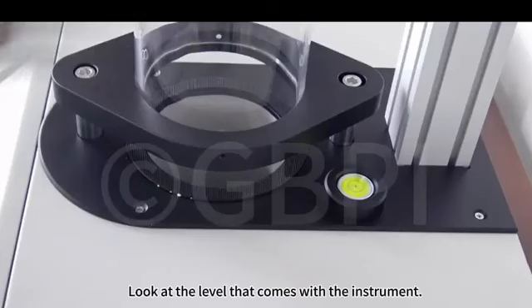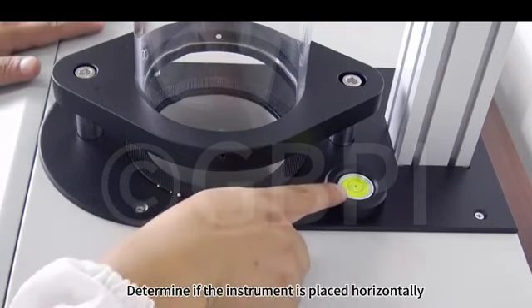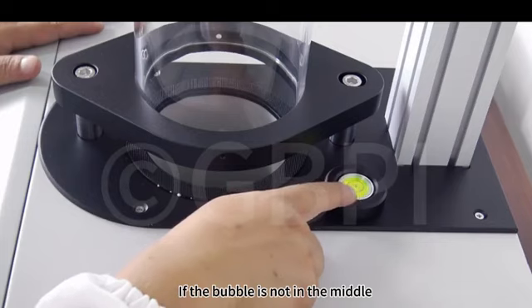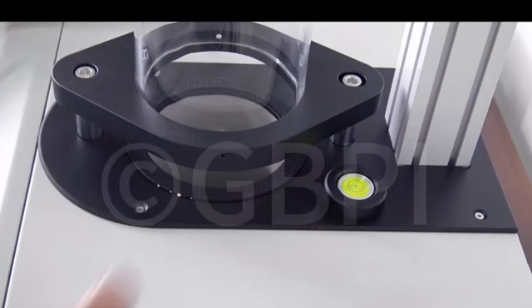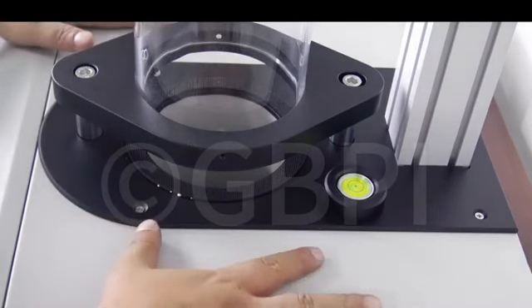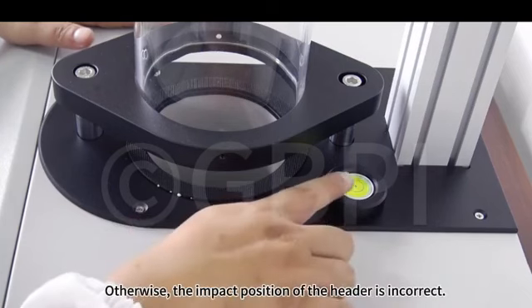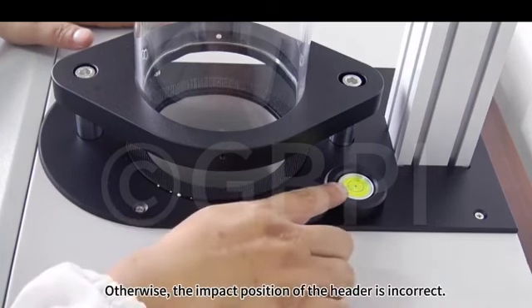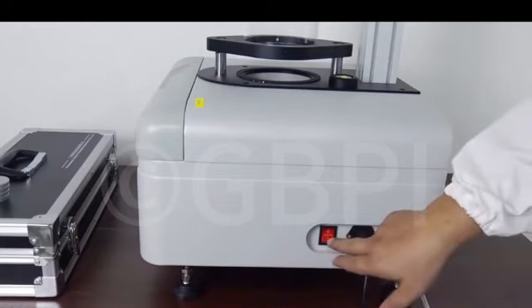Look at the level that comes with the instrument. Determine if the instrument is placed horizontally. If the bubble is not in the middle, we need to adjust the 4 corners of the instrument to adjust the balance. The level must be adjusted before use. Otherwise, the impact position of the head is incorrect. Press the instrument power switch.